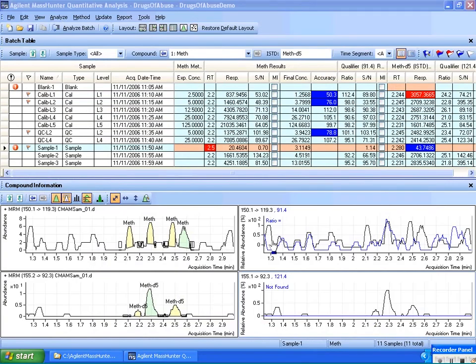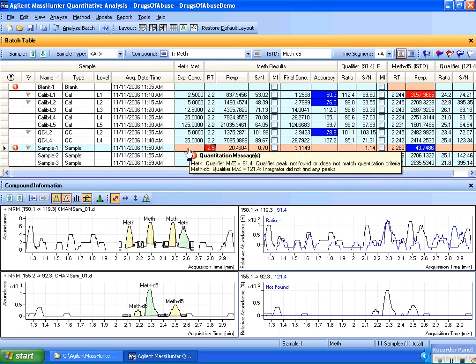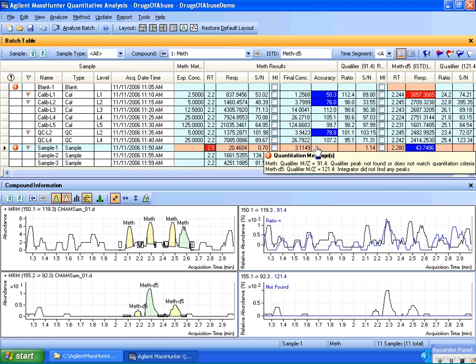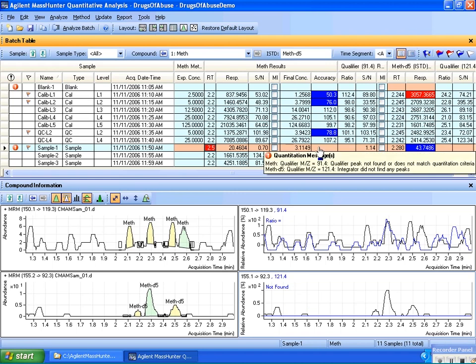Looking at sample 1, you'll see that the quantitation message over here is pointing out the messages that we just spoke about. Also, you'll notice for this row that the row involving the problem is highlighted red. In the case of methamphetamine for sample 1, you'll notice that the qualifier peak over here was not found. And that's why the quantitation message is warning you. It's also warning you for this sample that the methamphetamine ISTD, the deuterated compound, its qualifier is also not found. So that gives you quite a bit of information.